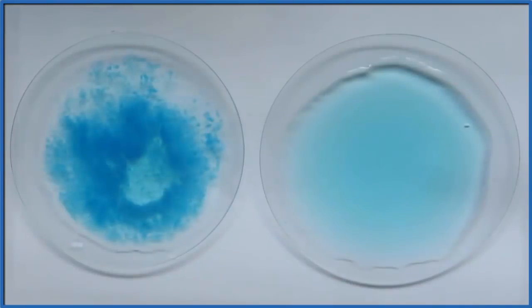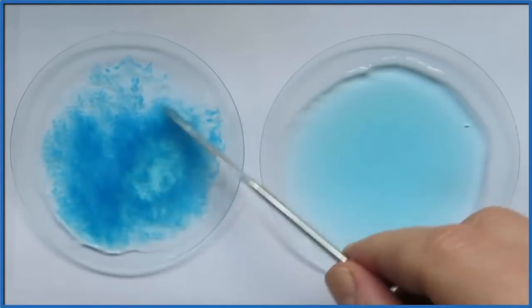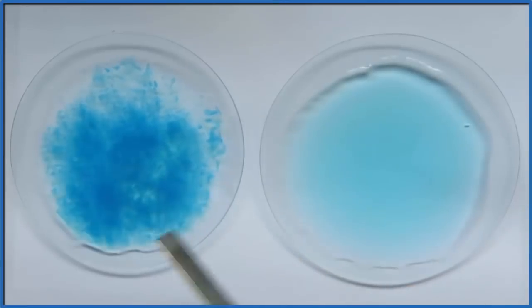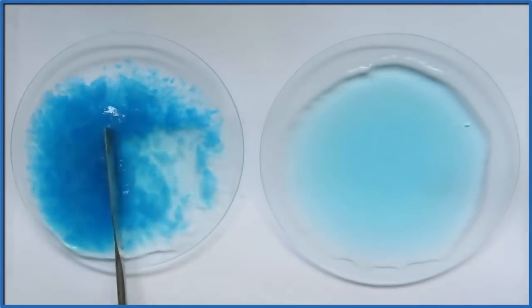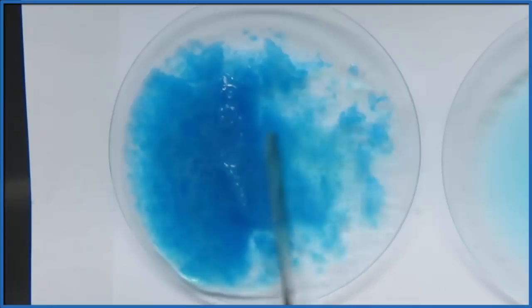And we can kind of separate it out, clump it up into a big pile of copper hydroxide. If we took that out, we could just dry it and have solid Cu(OH)2.